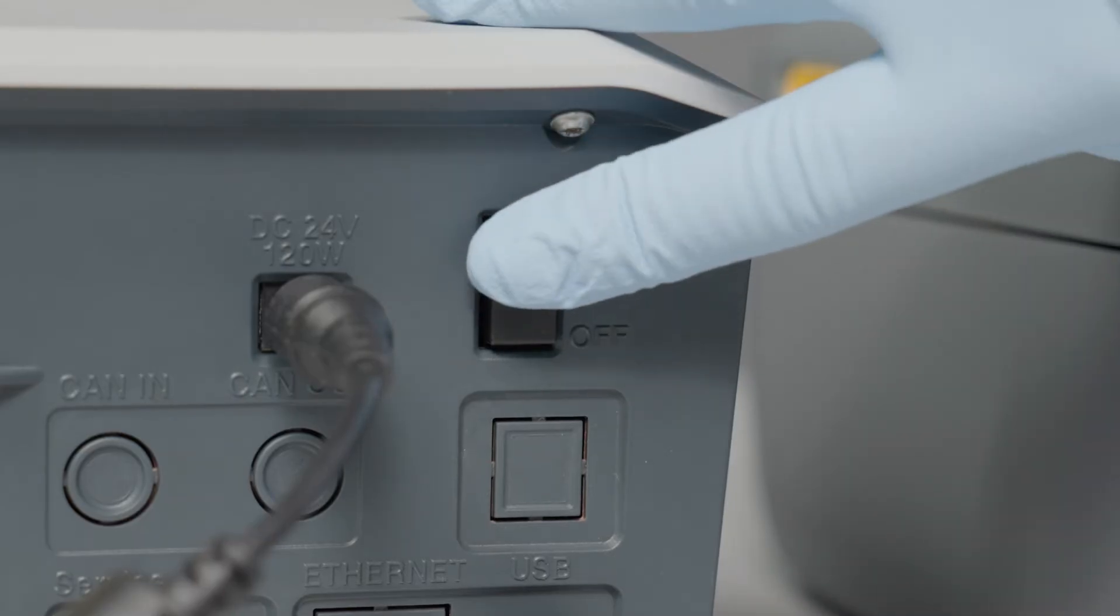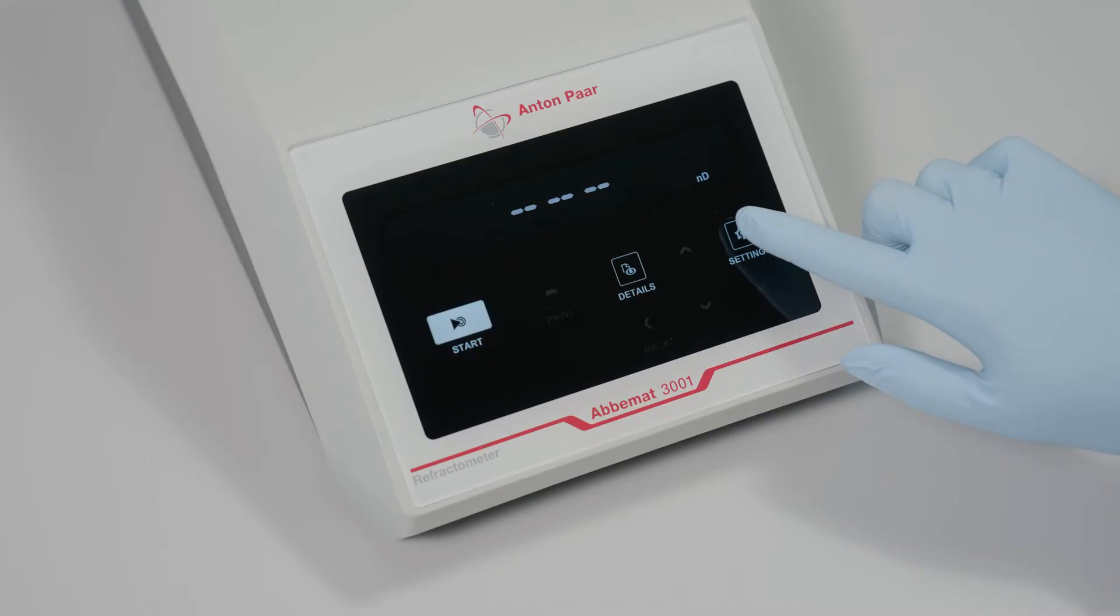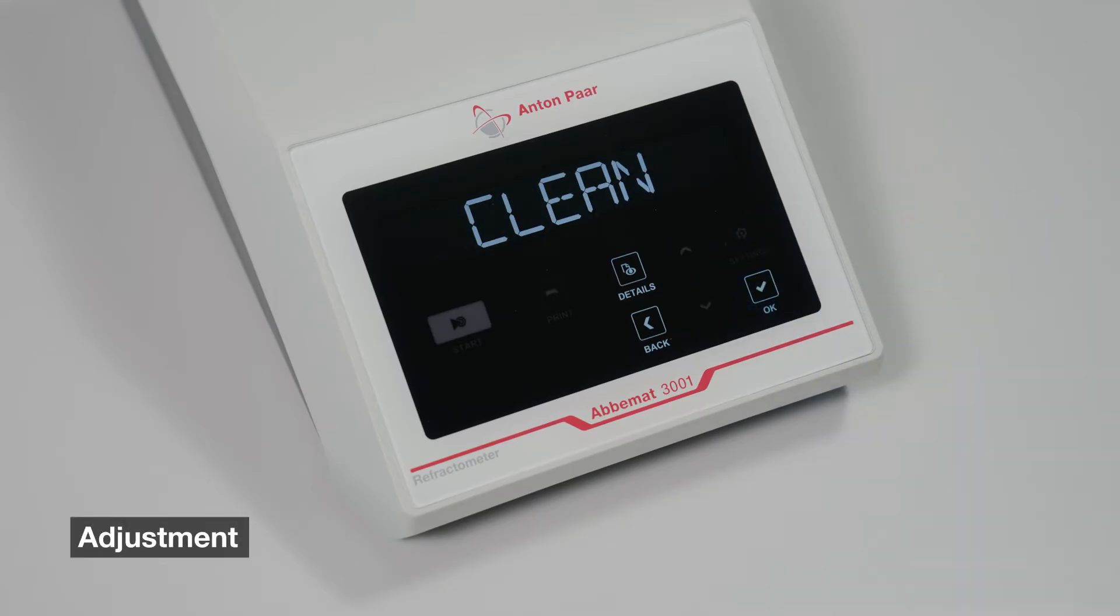Turn on the instrument. After installation and initial setup, it is recommended to perform an adjustment using UltraPure water.